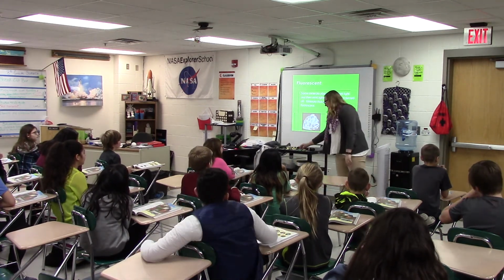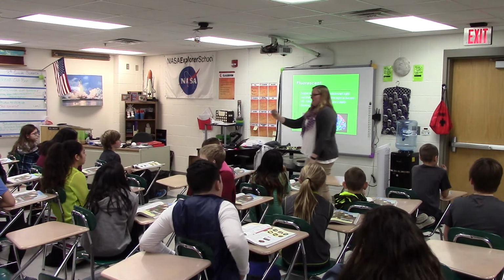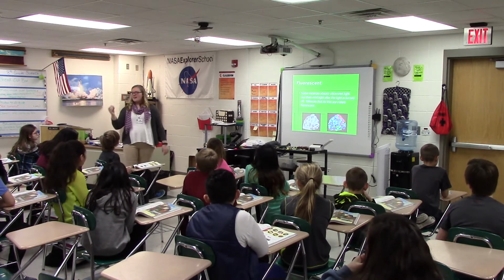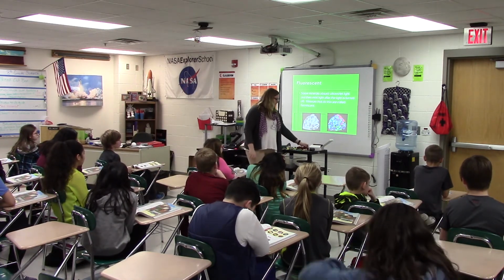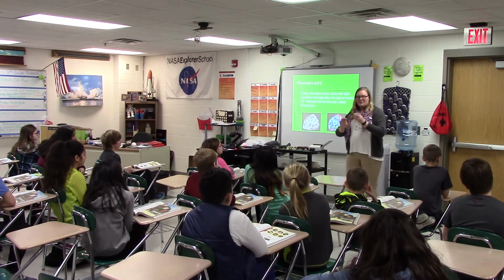Okay, and then our last one. What about this one? Gray. White, silver, kind of black, gray. So remember all those when we test them in the order that I just showed you. So first we're going to look at this one, which we said was white, yellow, some green.